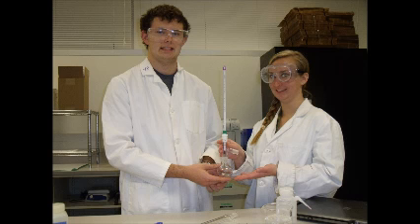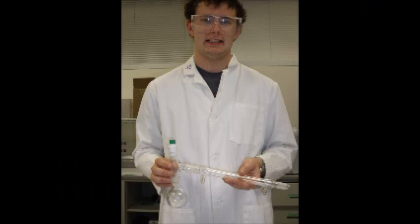Once we have our properly calibrated thermometer, we will insert it into the top of the still head. Next is attaching the condenser to the side spout of the still head tightly so as to ensure that it does not fall apart.